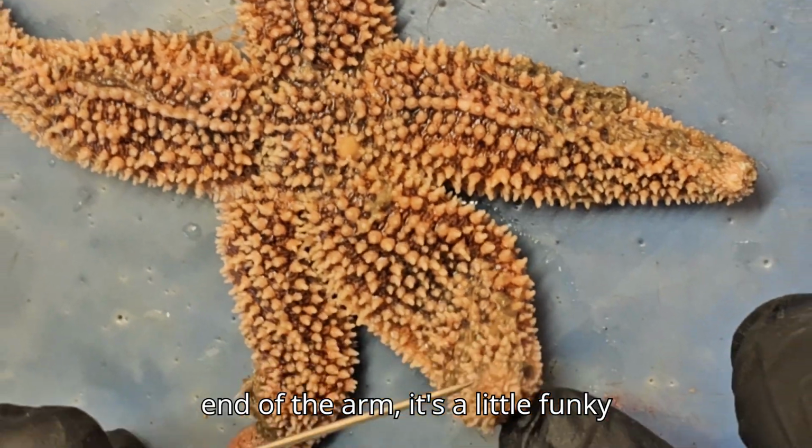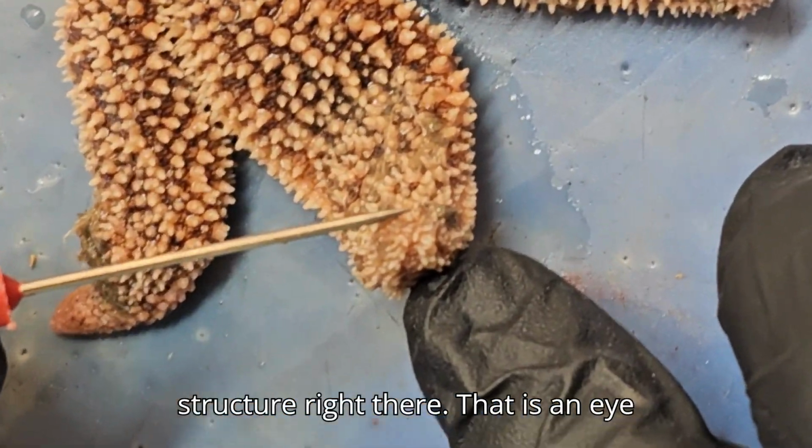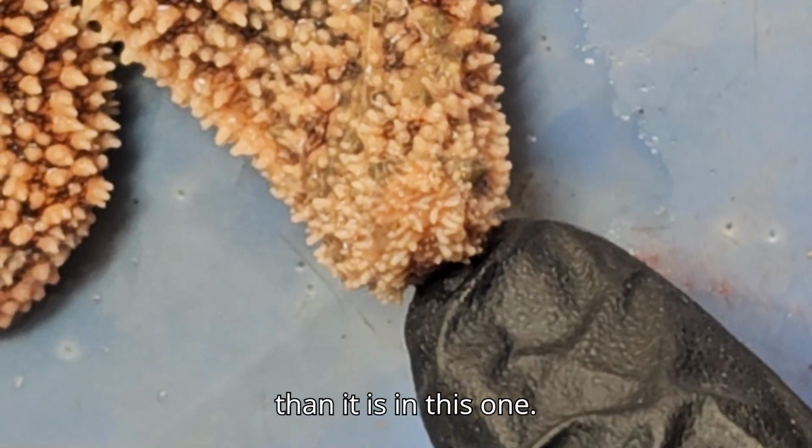Here at the end of the arm, you can see a little funky structure right there. That is an eye spot. In some sea stars, it's more obvious than it is in this one.